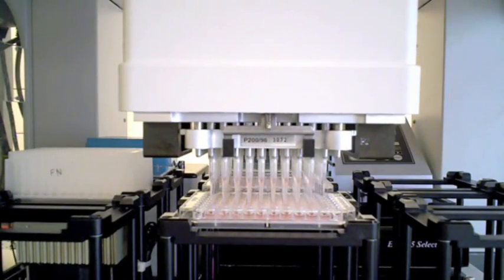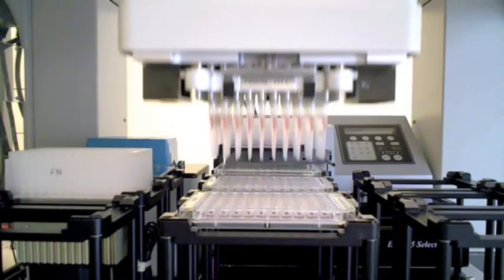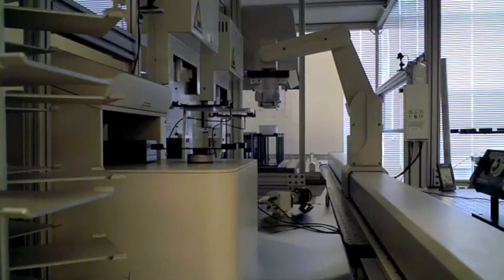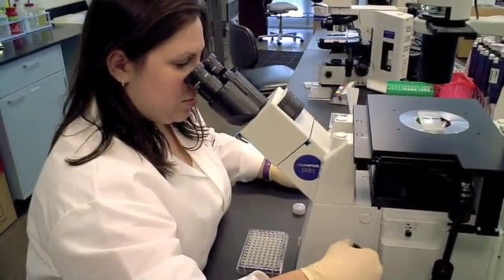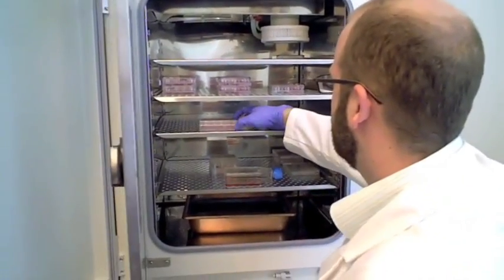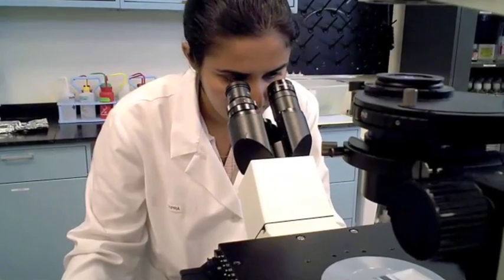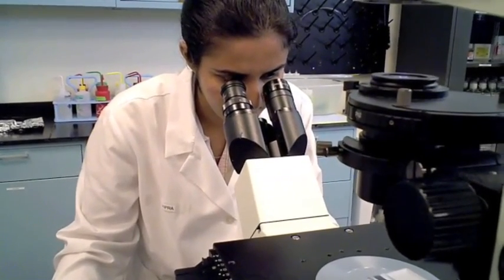VaxDesign's MIMIC System is a clinical trial in a test tube that simulates the human immune response in a high-throughput method. MIMIC System immune responses enable rapid, clinically relevant predictions about the efficacy of immunotherapies and vaccines. These predictions can dramatically reduce the cost and time required to bring such products to market.